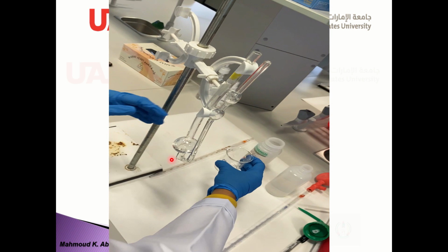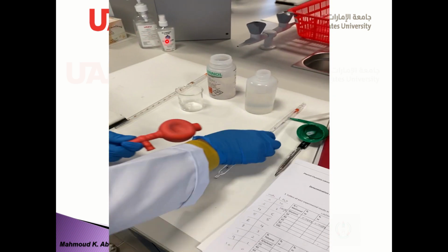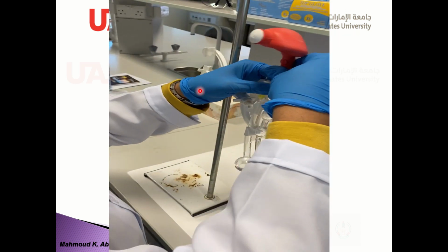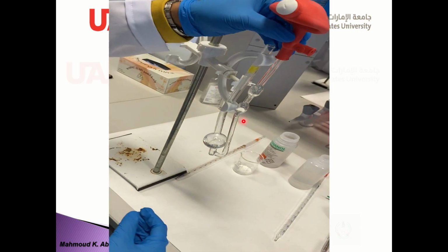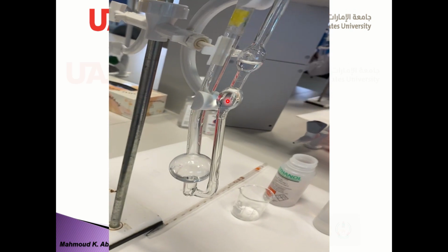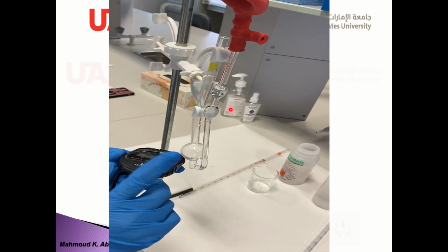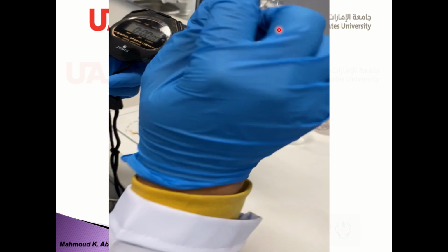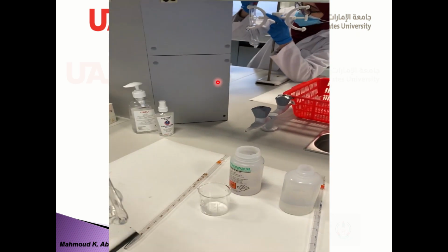Good. And then withdraw this volume of solution in the other side using the pipette filler or the rubber bulb. So the level of the solution increases in this side, till I would say it's enough. So I'm going to record the time, the flow time, between the two fiducial marks. I'm going to show you.